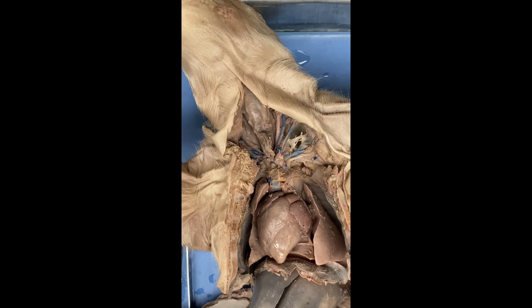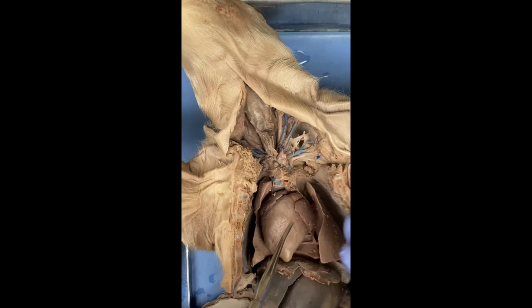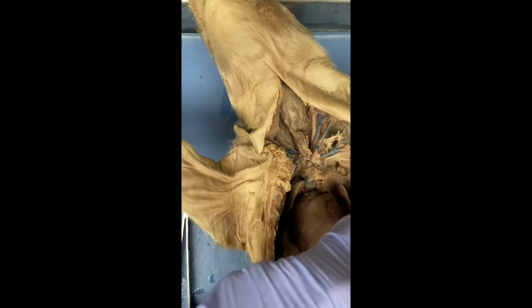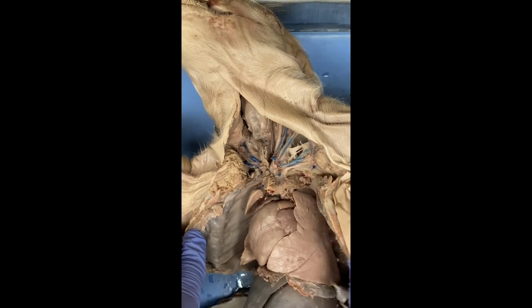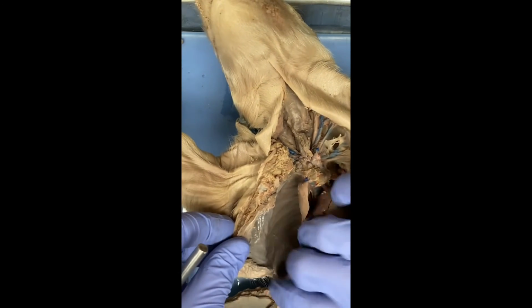The next is the aorta, which supplies the lower body with oxygenated blood. So you can find it on the heart, but you can also find it by gently teasing everything to the side. And let's see if I can get this on camera. I gotta figure it out. Here we go. Tease it this way.